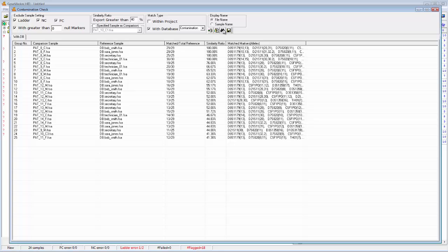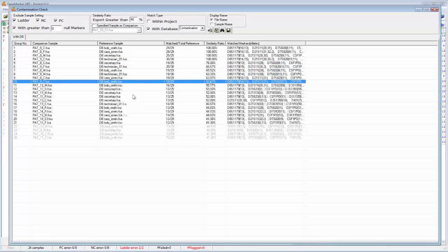So when I search against the contamination database, here are the results I get. You'll notice that the reference sample, if it comes from a database, has this little prefix DB. And it's virtually the same. I can see the similarity ratios. And in this case, these samples actually have 100% similarity ratio because I just renamed them with a different name. So these are actually identical samples, and then these samples have quite a bit in common.